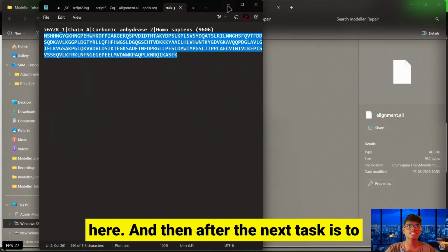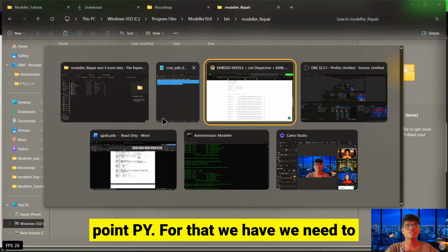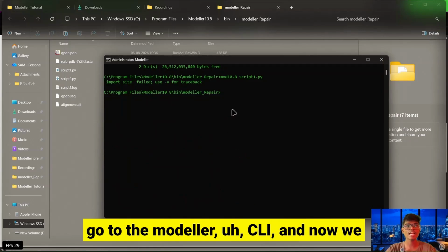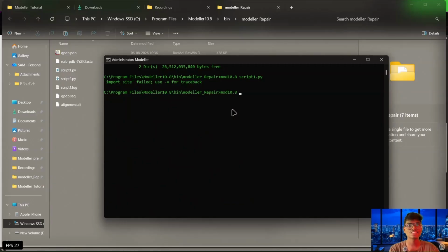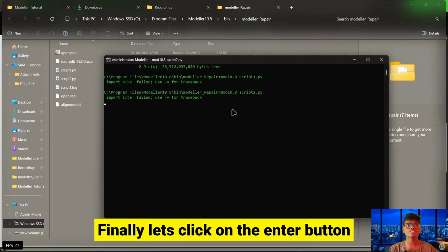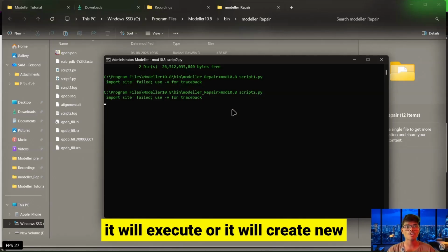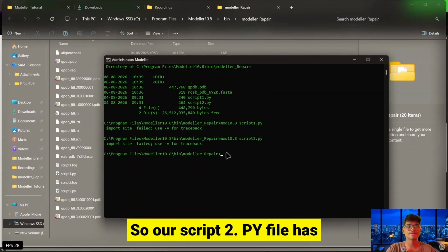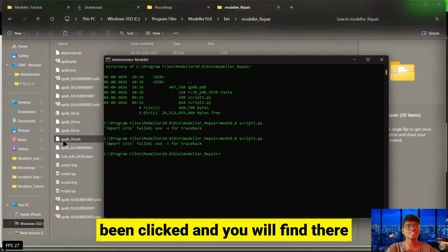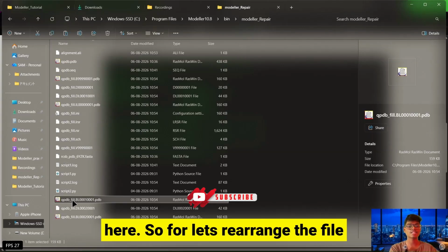And then the next task is to run the second script, that is script2.py. For that we need to go to the modeller CLI, and now we have to hit the same command, that is mod10.8 script2.py. Finally, let's click on the enter button, and it will take some time and execute, or it will create new types of files over there. So our script2.py has been run, and you will find there are multiple files registered here. So let's rearrange the files.